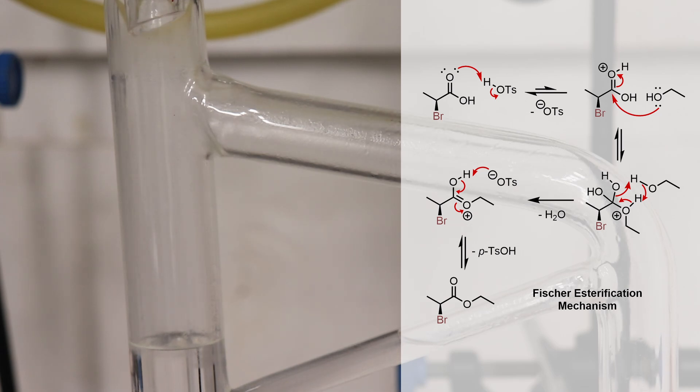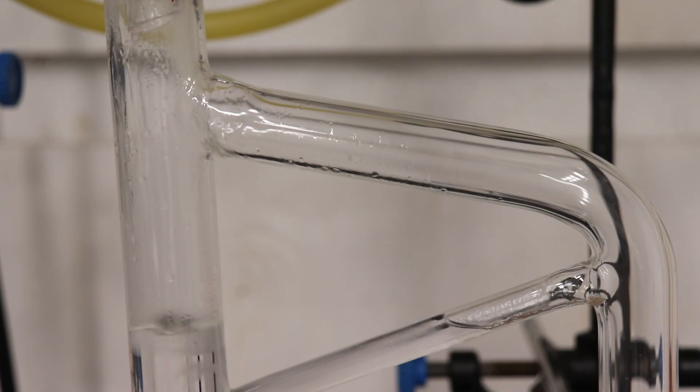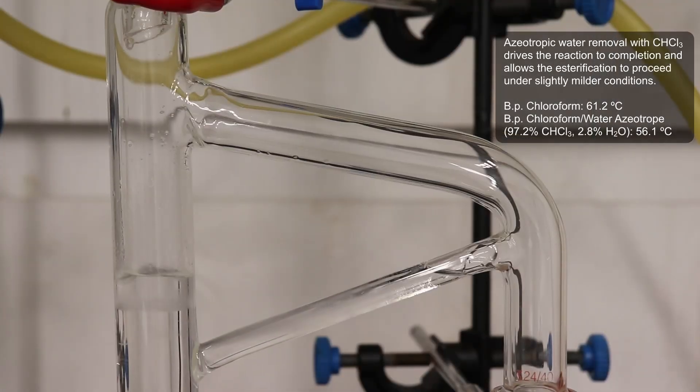By physically removing the water from the reaction flask, it prevents the reverse reaction of the ester being hydrolyzed back into the starting materials, resulting in an overall improvement to the yield.